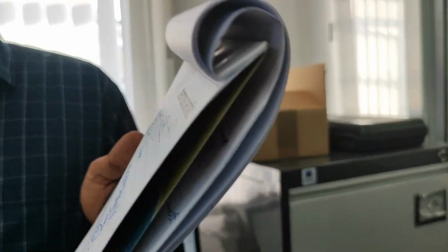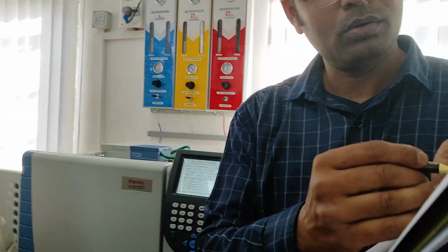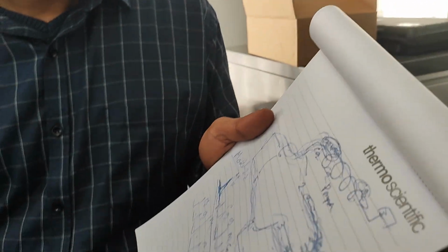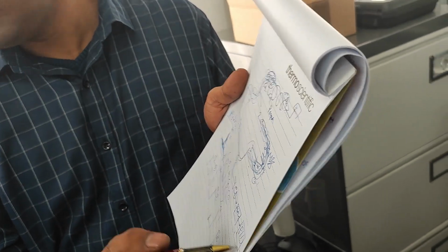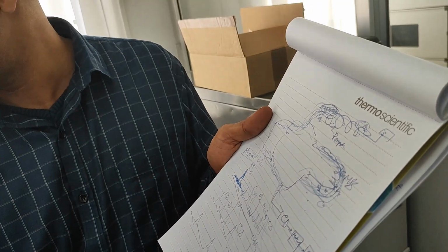Okay. This is model 1, model 2, model 3. 3 models can be used here. Here we are using model 2, depending on this column length. At the same time, the same sample is going through the methanizer and FID. So at the same time, we can get some peaks in FID also.